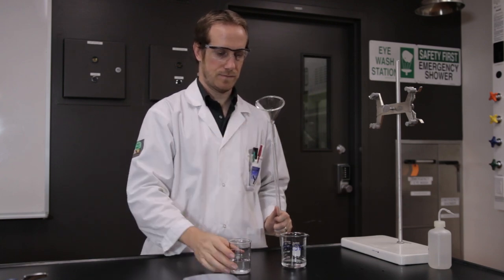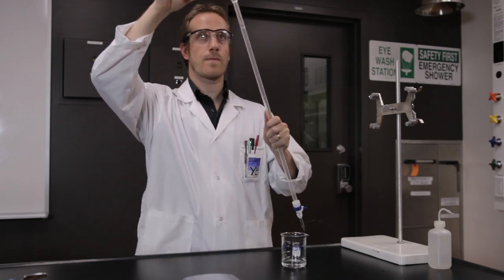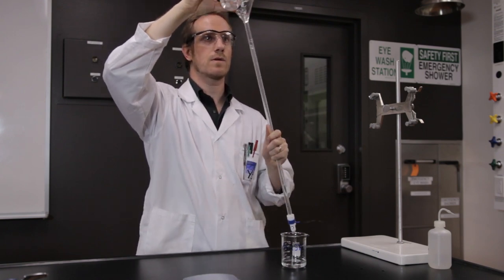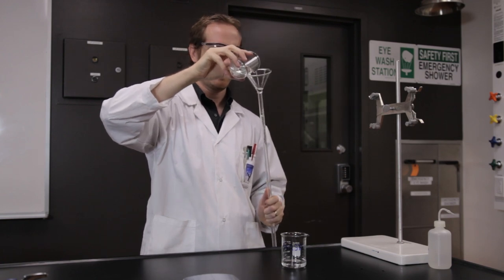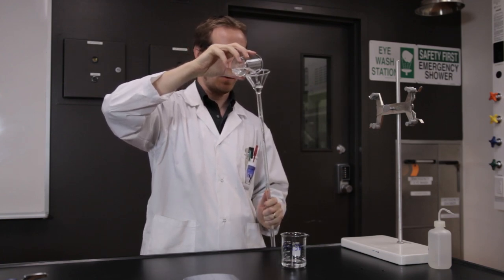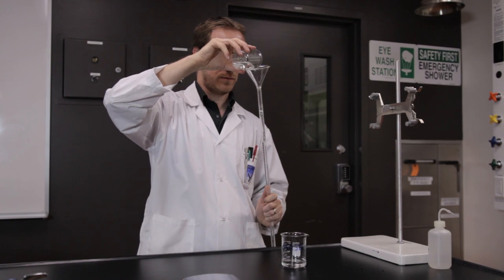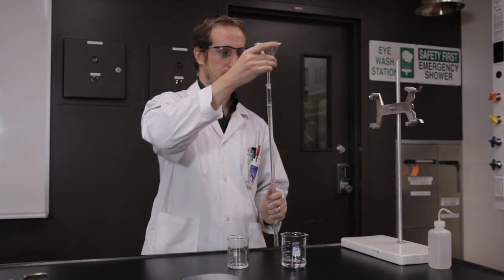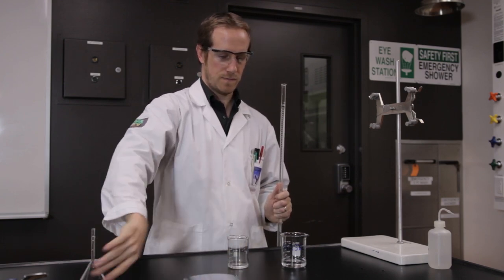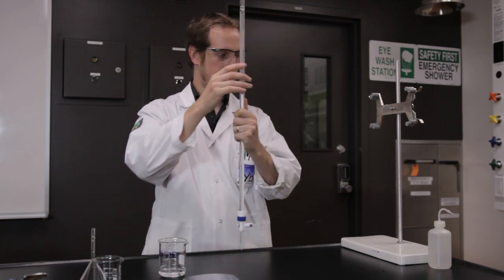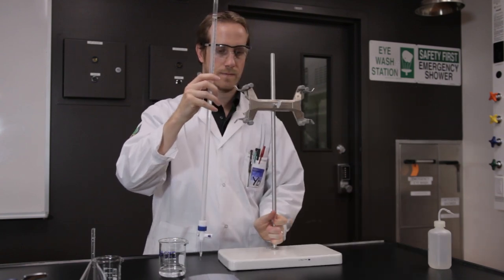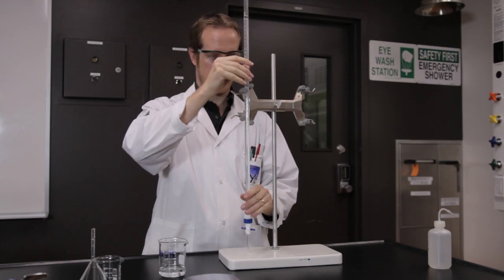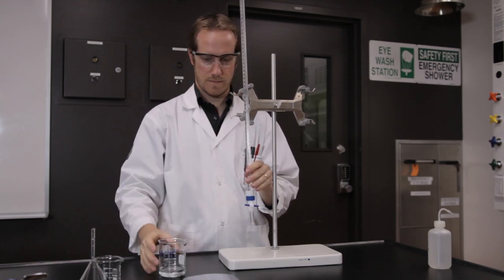Secure the burette to a stand using a burette clamp and fill the burette with the sodium thiosulfate solution. Ensure the burette is sitting properly in the grooves. It should be sitting straight up and down, not leaning forward or backward.